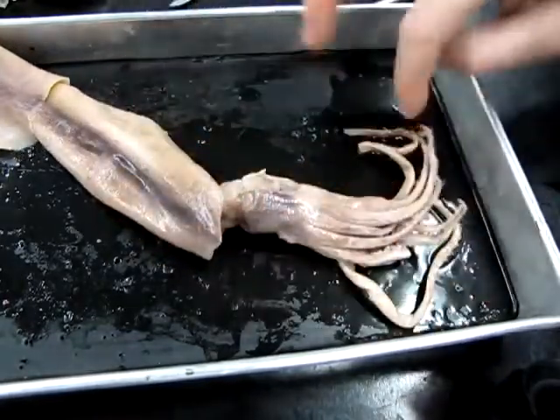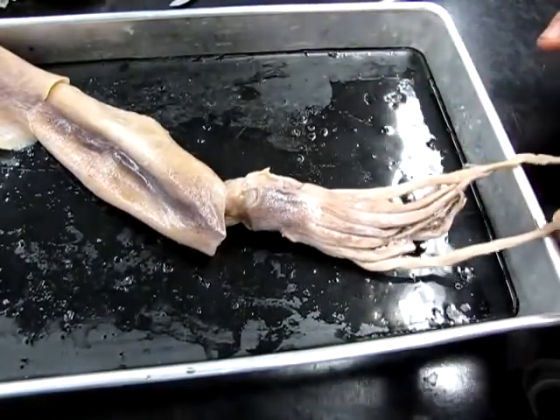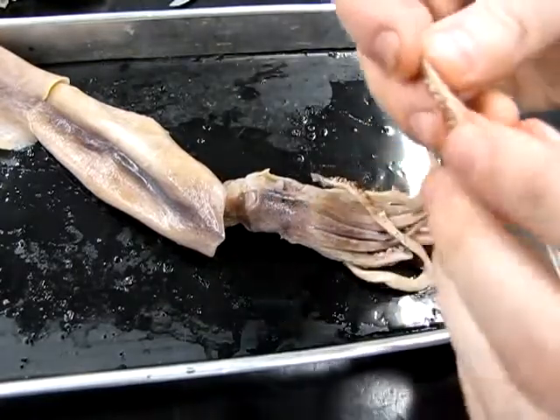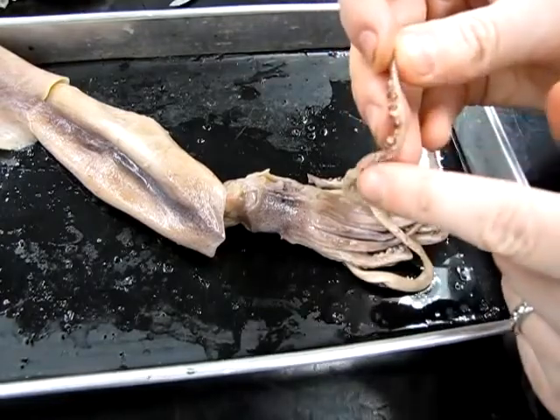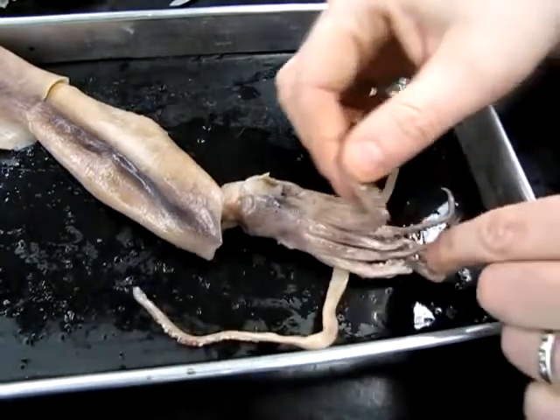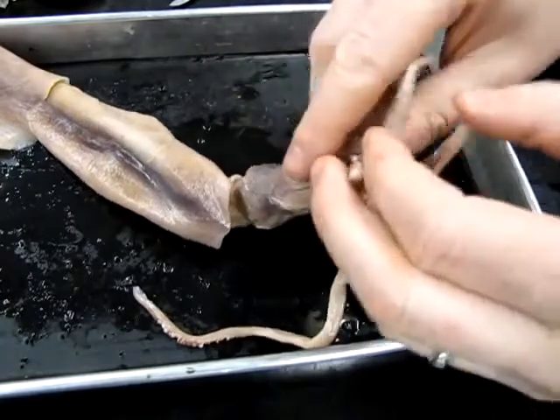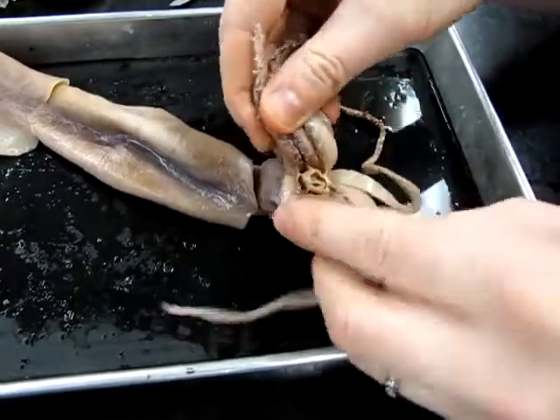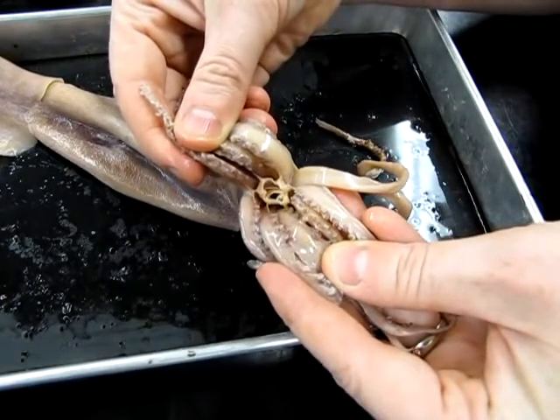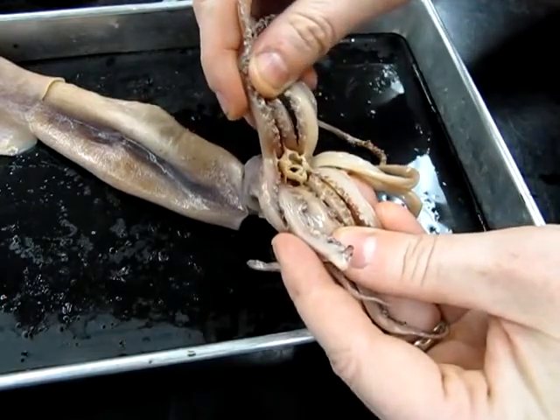And then we also have 10 little appendages down here. There are two which are very long. You can see how much longer they are than the other ones. These are the tentacles, and the tentacles are covered in these great little suckers, which are used to help grasp prey. The ones that are not tentacles, the short ones, there's 8 of them, and these are the arms. These are more used in handling food and pulling things to the mouth. And if we open the arms, you can see the mouth in there, and that also contains the beak. All right, so that is a basic tour of the external anatomy of this animal.